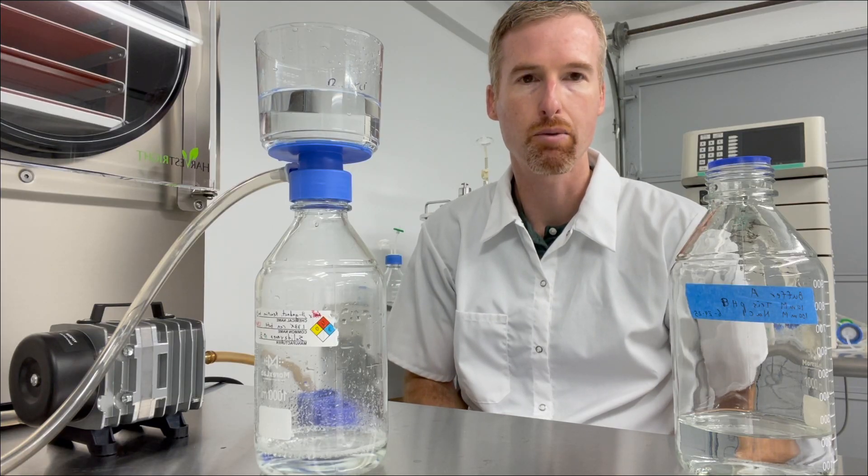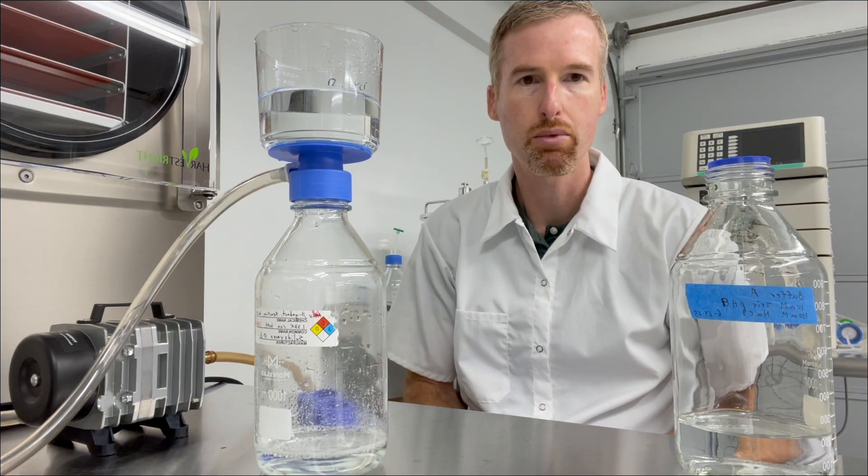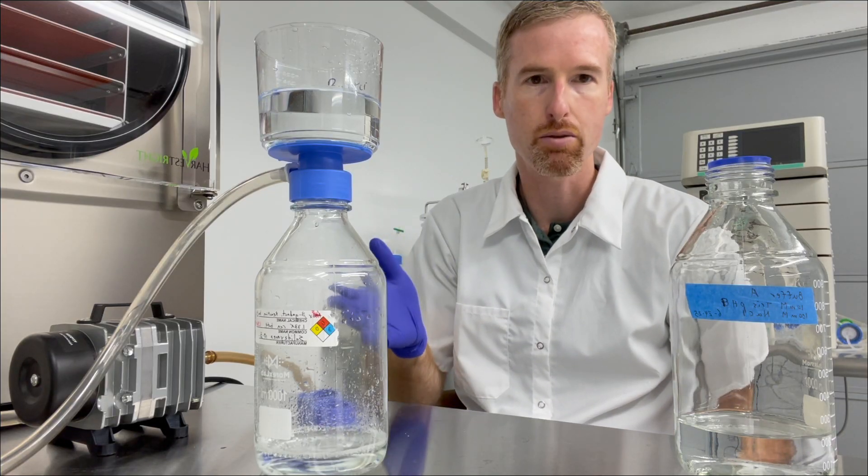The buffers need to be filtered and degassed, and we're going to do both of those things in one process, which is vacuum filtration.